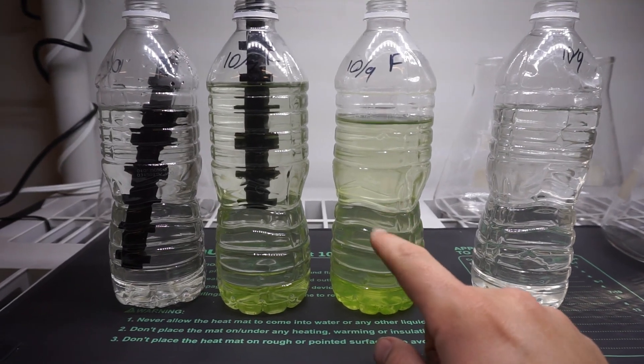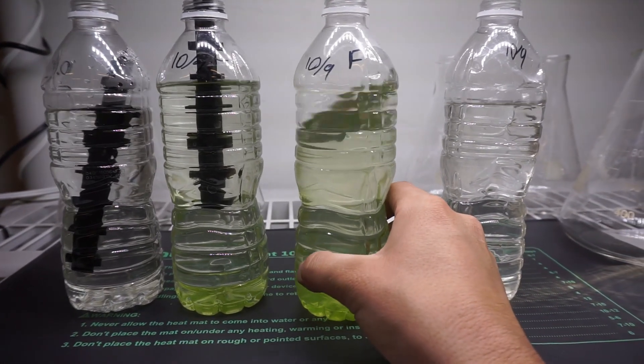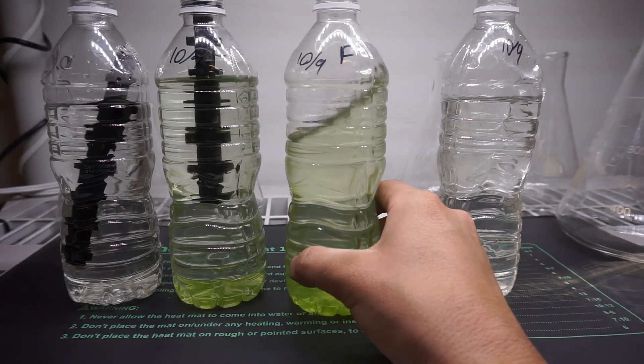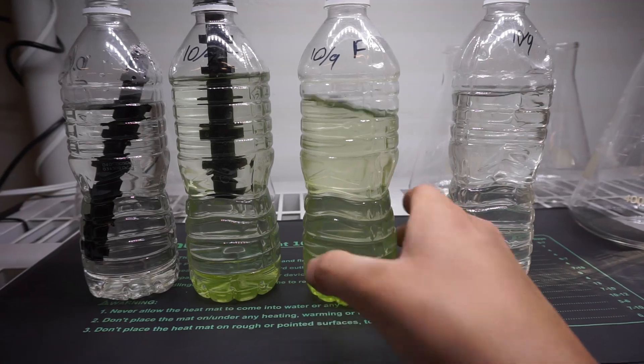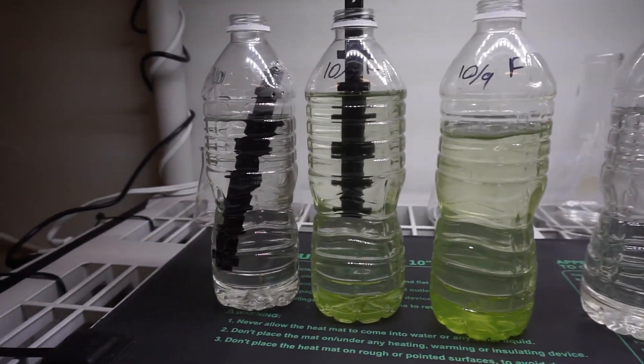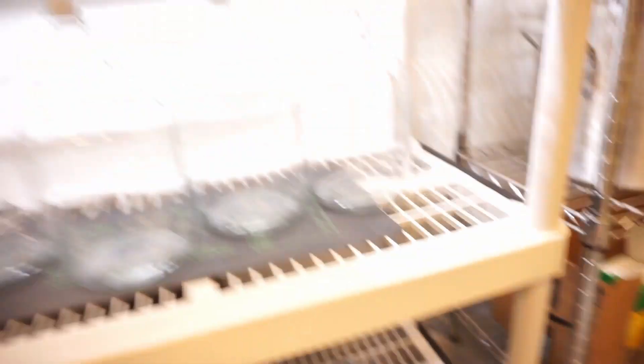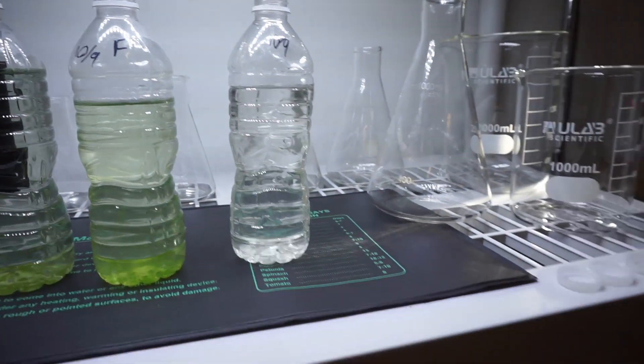You can see this one's missing a little bit of water, and normally what I've been doing every day a couple times a day is just swirling them like this and letting them kind of just mix up a little bit. But today I decided to try and percolate them with air.